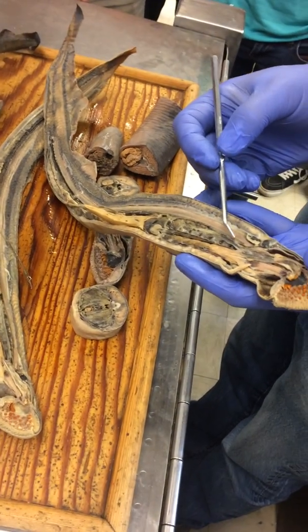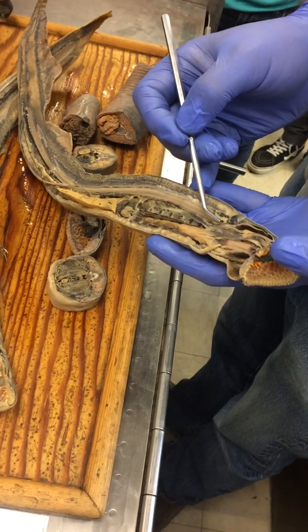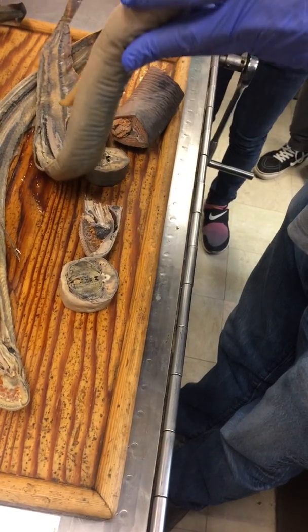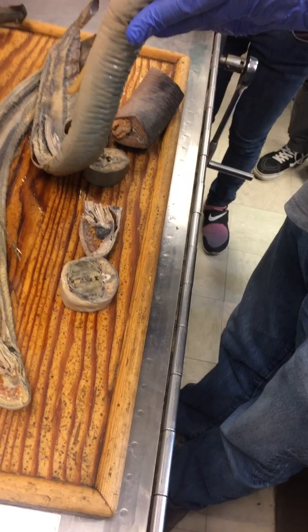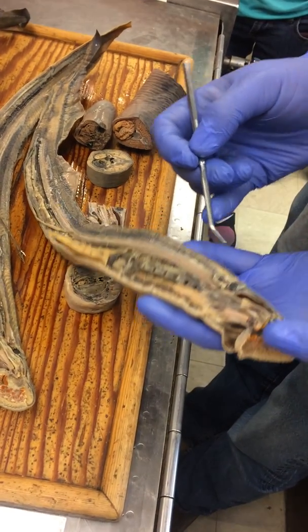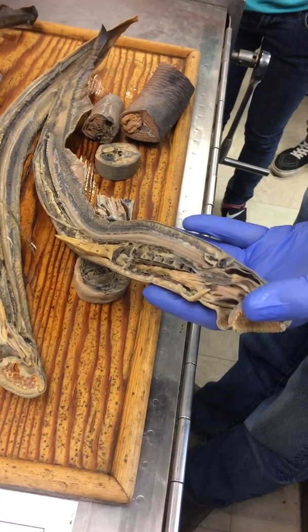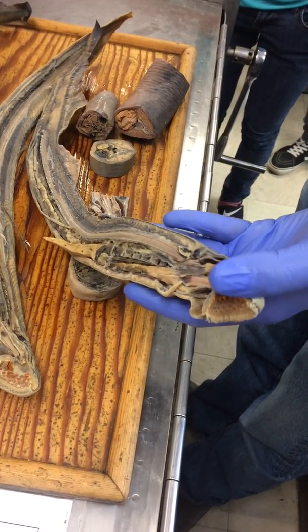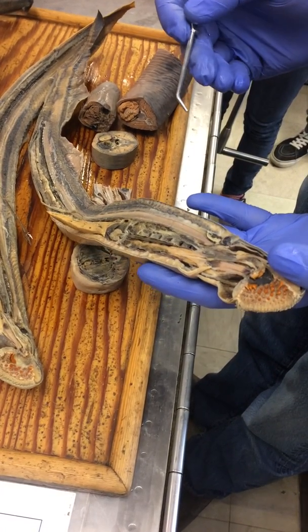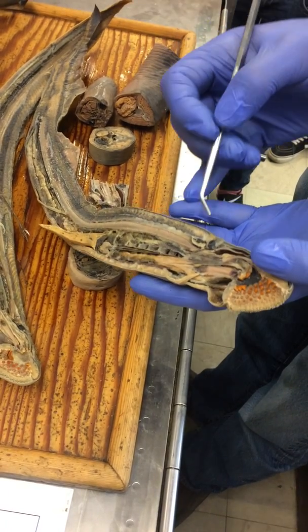Up at the front end of the notochord, notice that it stops here — it doesn't run all the way to the front of the head. But right there above it is this whitish structure, and that would be the brain. It's hard to see on the adult, but there are three parts of the brain: the forebrain, midbrain, and hindbrain. They should show up pretty well on those ammocoetes larvae. Forebrain, midbrain, hindbrain is good.